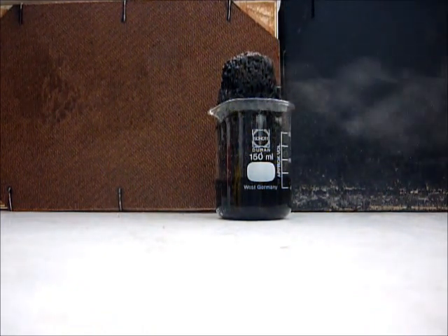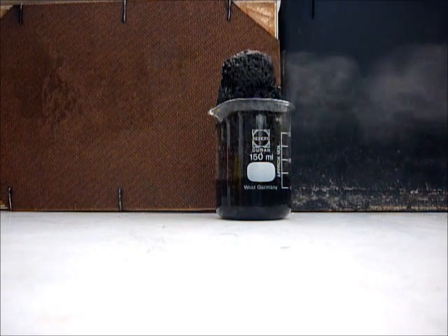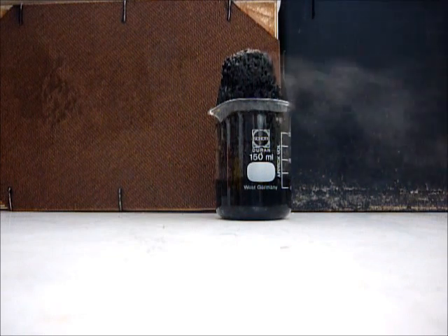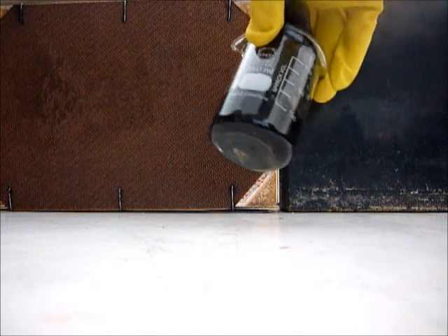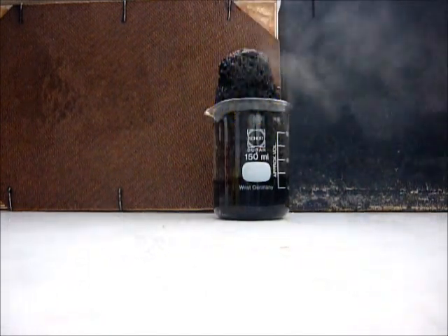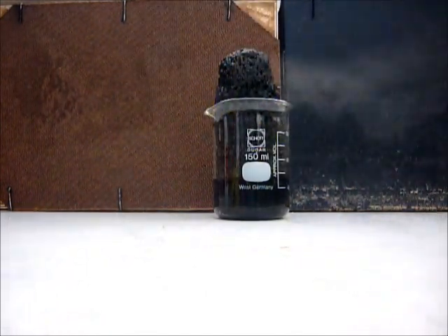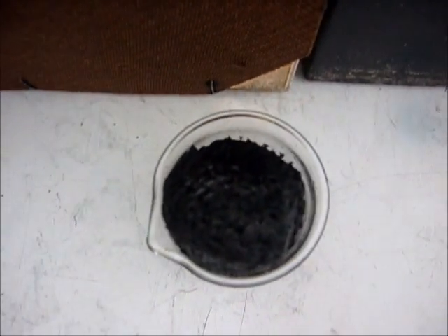You see it's fuming from the water which is evaporating because it's very hot. It gets over 100 degrees. Let me show you from the top. This is a column of carbon from the top.